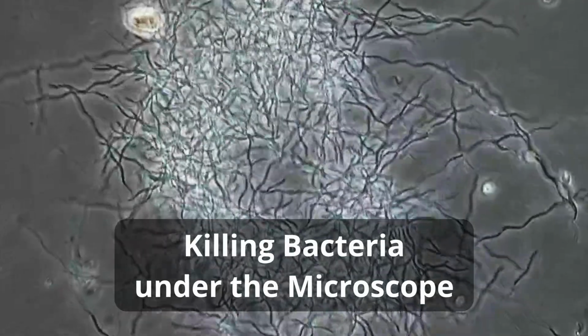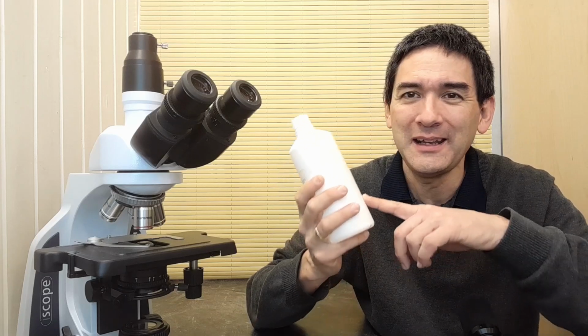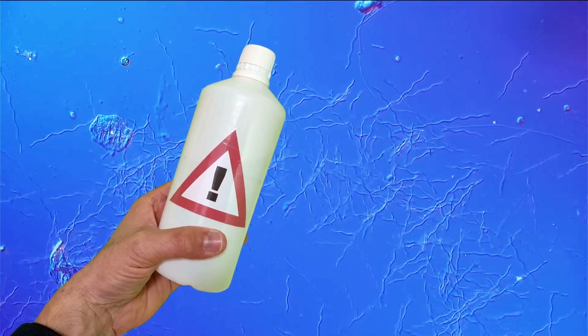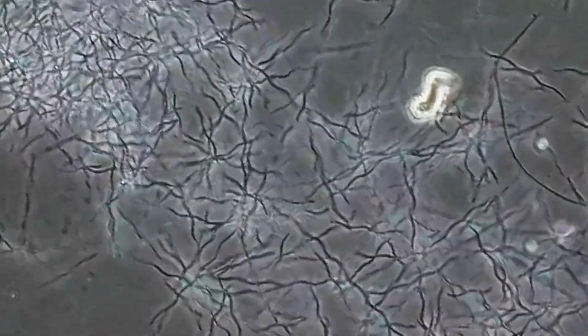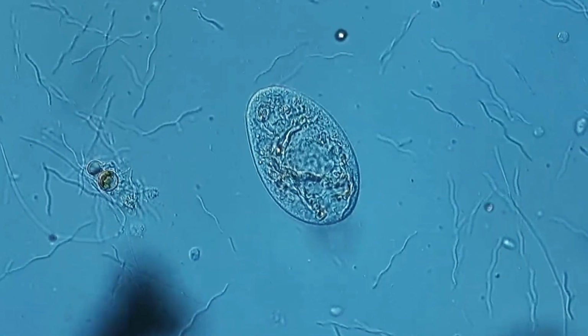So these spiral-shaped bacteria that you see here under the microscope, they're not going to be very happy for long, because today I'm going to add a hand disinfectant to those bacteria, and I would like to see what happens to them. Well, I can already promise you right now, they're not going to be happy about that. They're going to die. We're going to watch how this actually happens, and then towards the end of this video, I'm also going to show you the effect of this hand sanitizer, this hand disinfectant on larger cells, like for example the ciliates, which were also present in the sample.